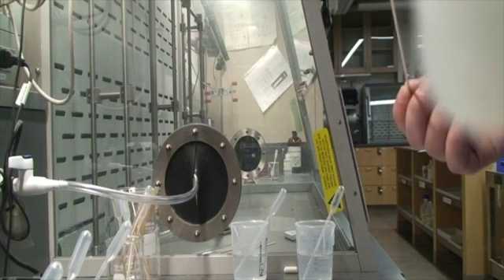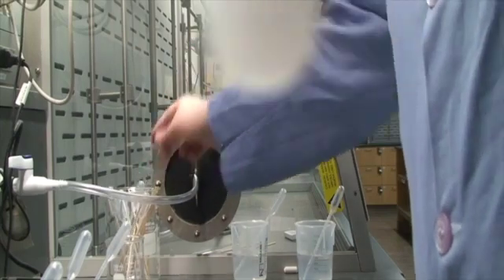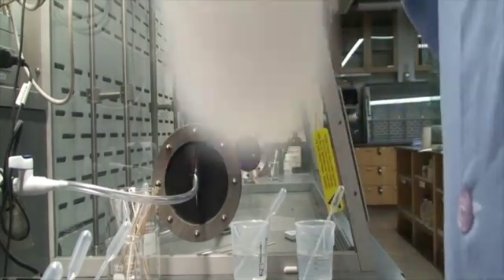Okay, so we're going to switch over right now so that we can do our flame test. So stand by.